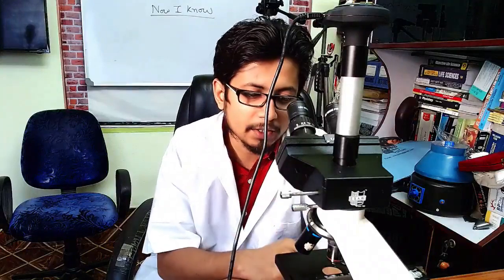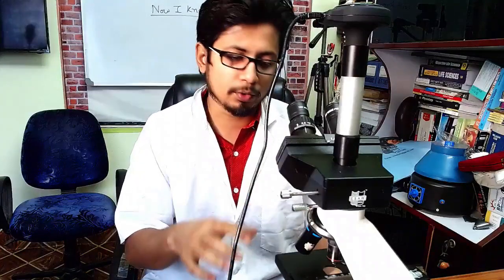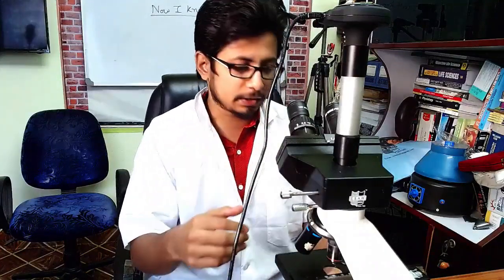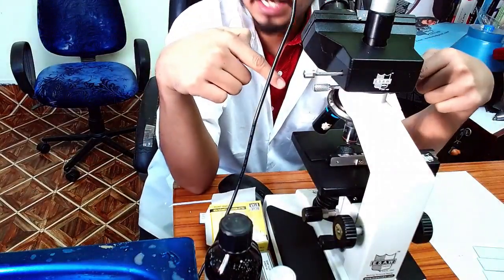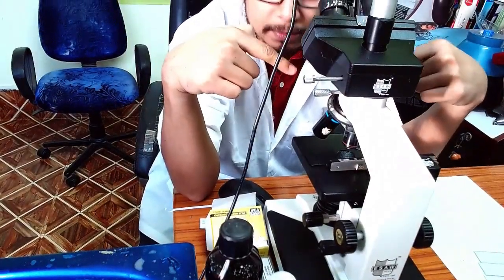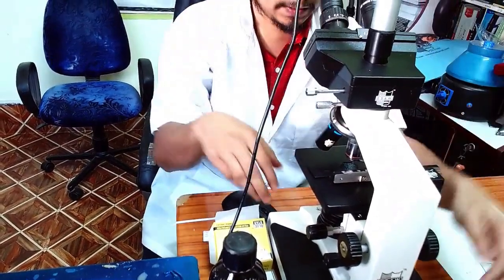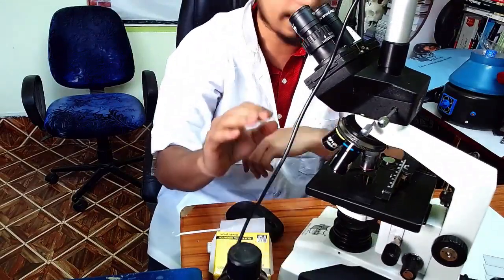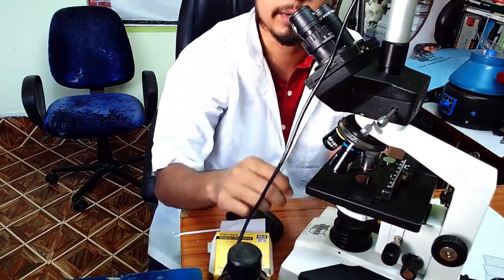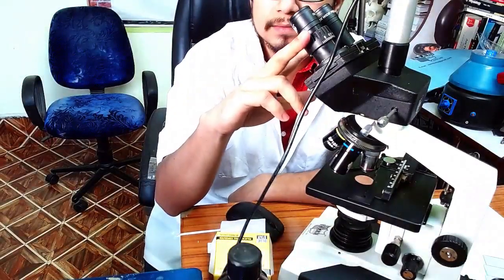Without talking too much about it, I'm going to take this camera in my hand and show you exactly how the focusing of a microscope works. You can see the microscope stage here. You may not see my face, but this is where we are going to talk about the setting of the microscope.